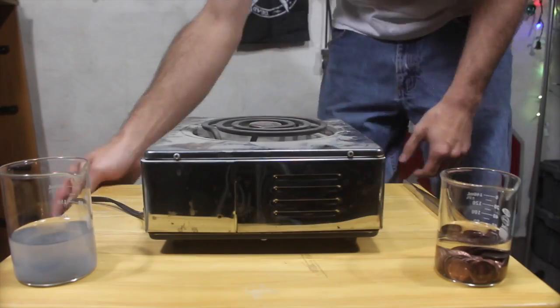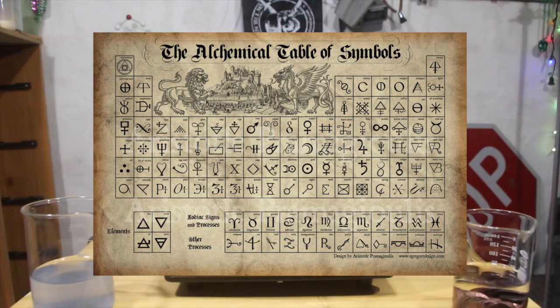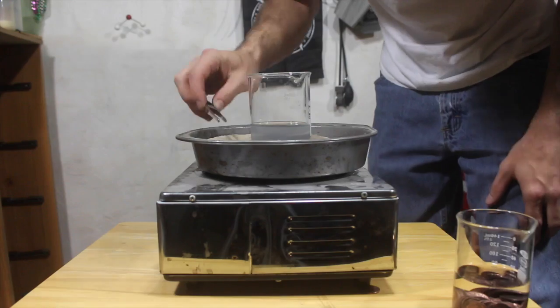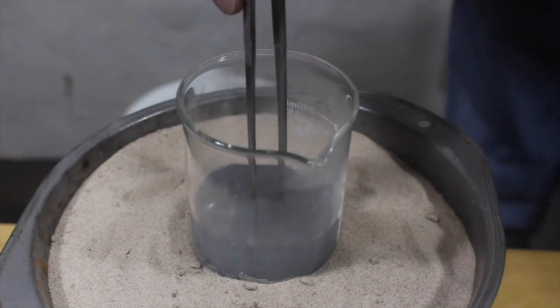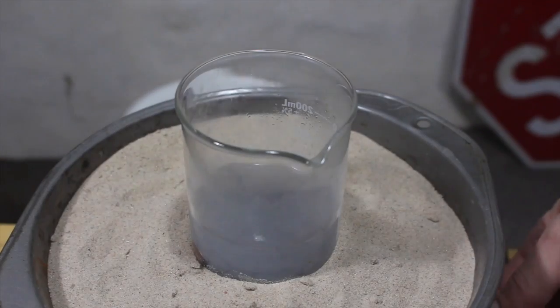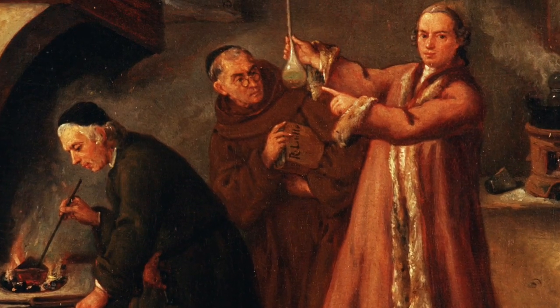The origins of alchemy date back centuries to ancient Egypt. One major aspect of this idea was to convert base metals like copper or lead into precious metals like silver and gold. Here I've created a solution and heated it up to facilitate the conversion of copper to silver. We just need to let the pennies soak for a few minutes. These practices also led to early investigations into chemistry and medicine as alchemy spread throughout India, Asia, and eventually Europe.